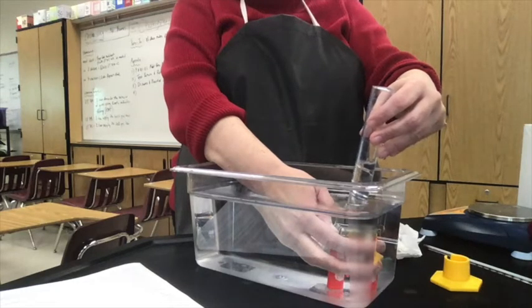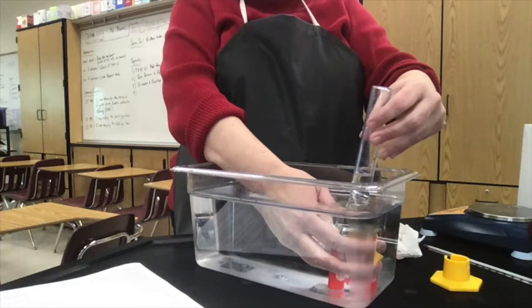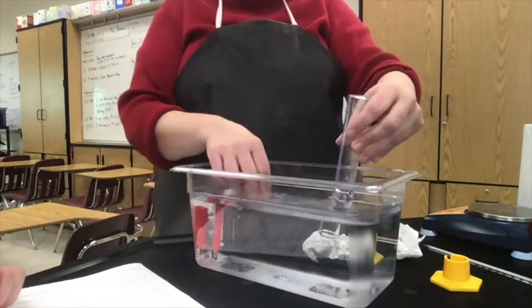And again, the exact amount you collect here doesn't matter. We're only going down to 45 because butane being a gas doesn't have a very big mass, and so we want a decent enough mass sample, so we have to go down somewhere between 40 and 50. It doesn't matter exactly where you stop, but you have to read your graduated cylinder exactly when you get down there. So if I don't stop right on the 45, it's no big deal. I'm almost there. You just can't go past the 50 milliliter mark, because we have no markings after that point.